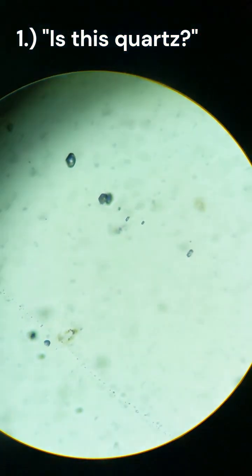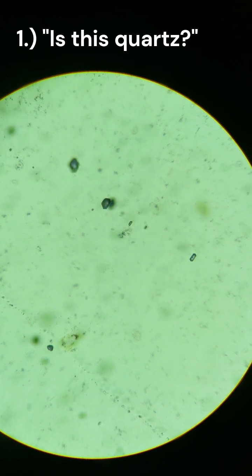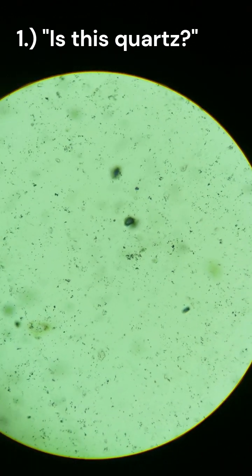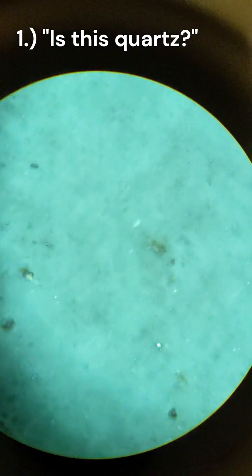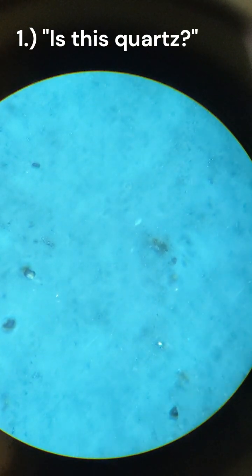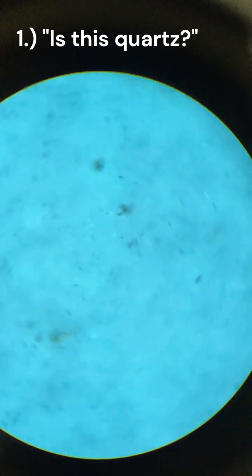This is thin section number 95, magnification 4, going to magnification 63x. It's about focused right now. I'm going to turn on, or rotate, no pleochroism. Analyzer's on, we're on crossed polars now at 63 magnification. Rotate it around, no extinction.